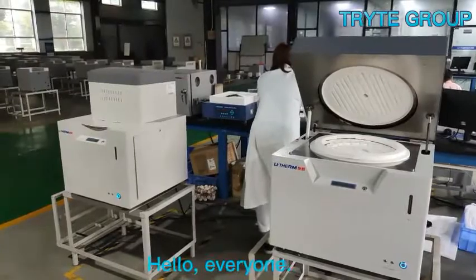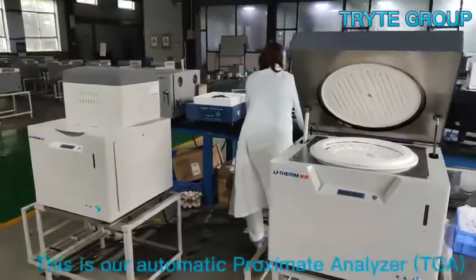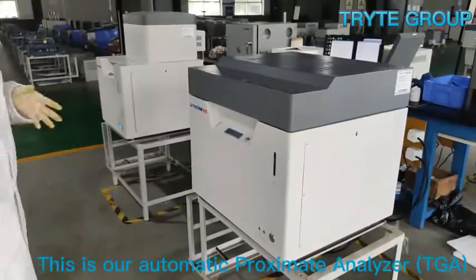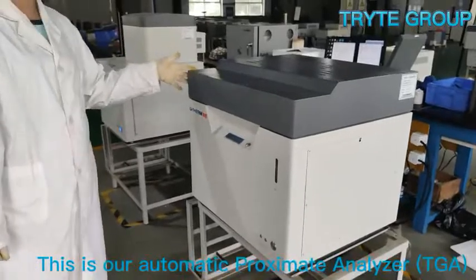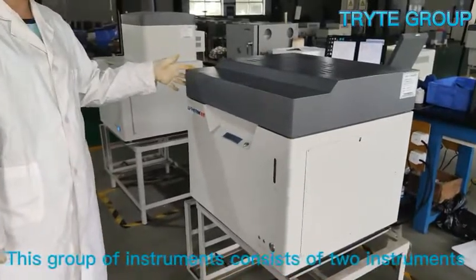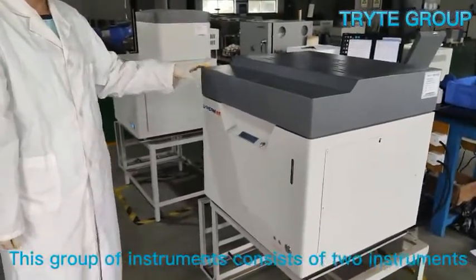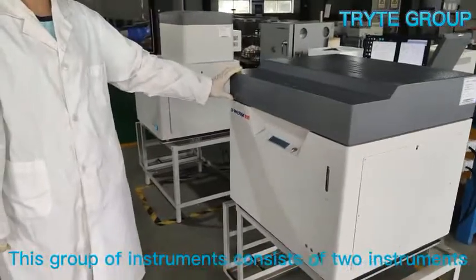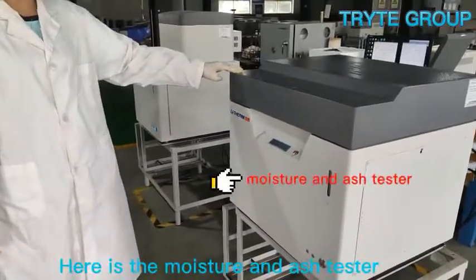Hello everyone. This is our automatic proximate analyzer TGA. This group of instruments consists of two instruments: here is the moisture and ash tester, and here is the volatile matter tester.